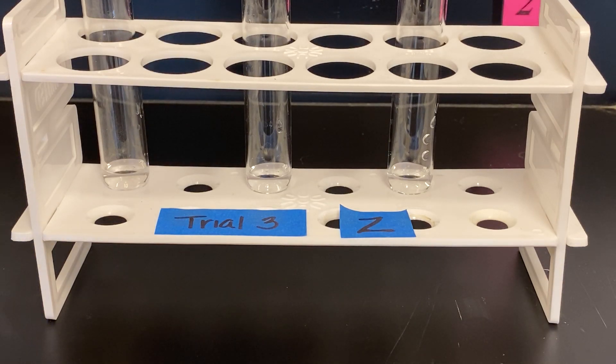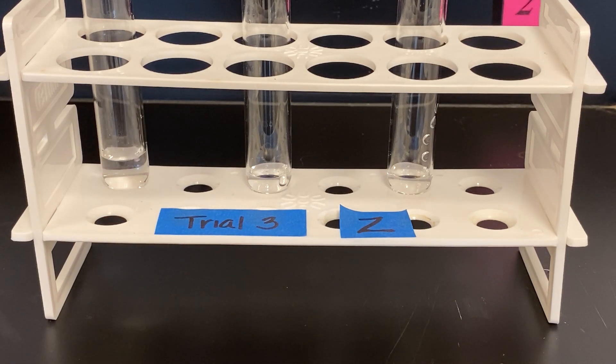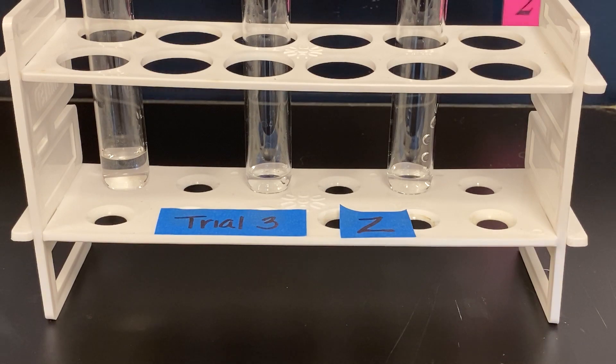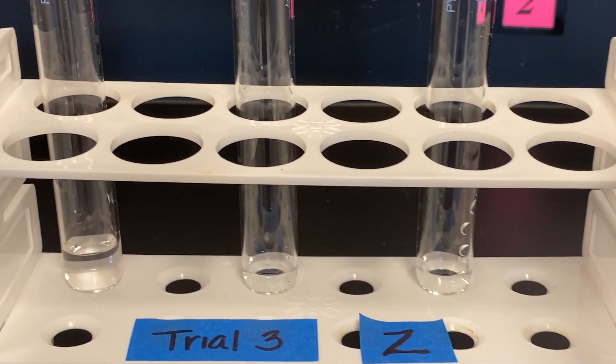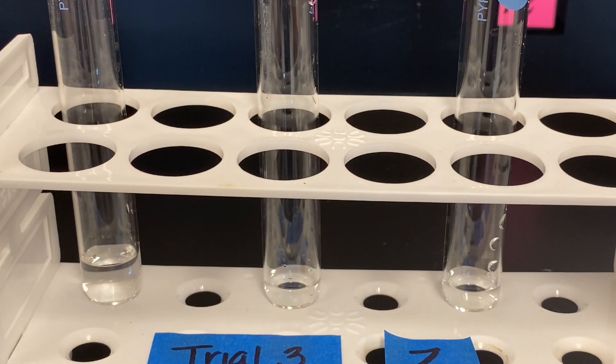Now we will add unknown solution Z to Z. We will add unknown solution X to Z.